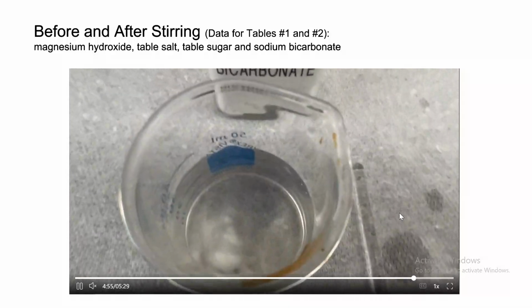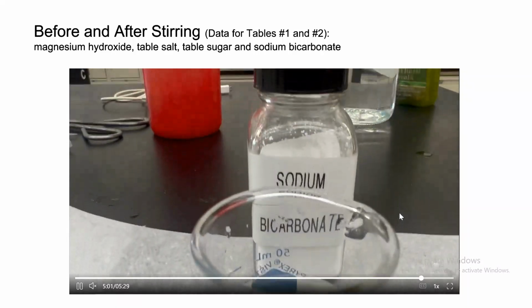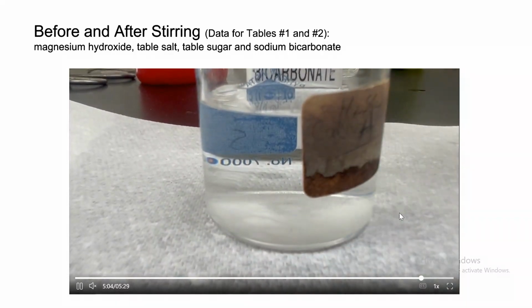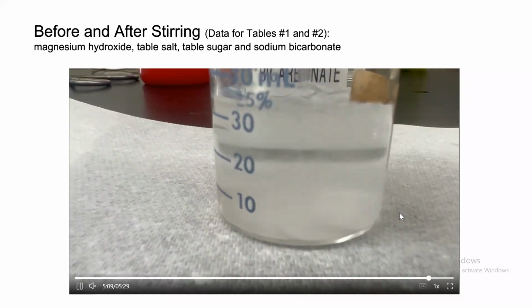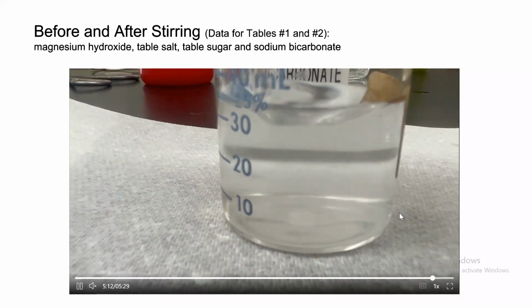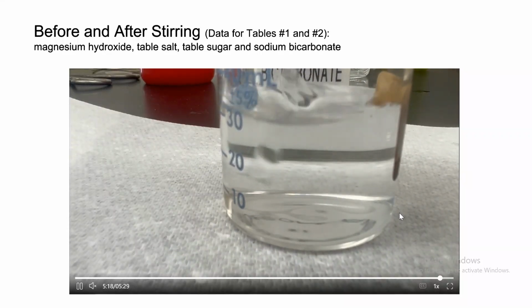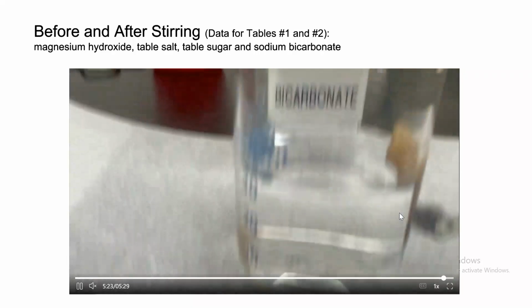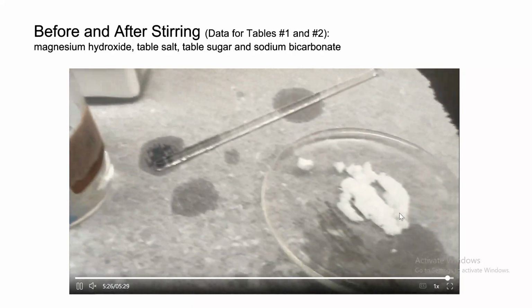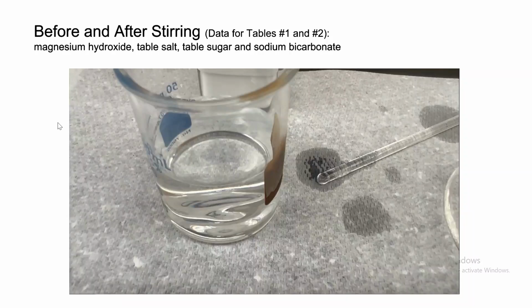Notice the sodium bicarbonate, just like salt, just like sugar, goes all the way to the bottom. So for table one, you're going to write sinks and more dense. Now we are going to try to dissolve it with the stirring rod. And notice, what do you see? Yes, it does dissolve. So for table two, the observation will be dissolves, which means it's soluble. Sodium bicarbonate is soluble. So write it for magnesium hydroxide, table salt, table sugar, and sodium bicarbonate.